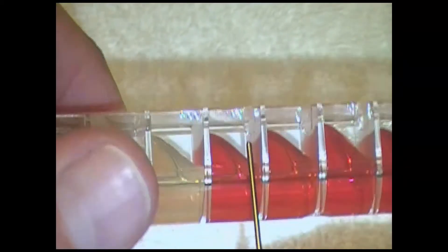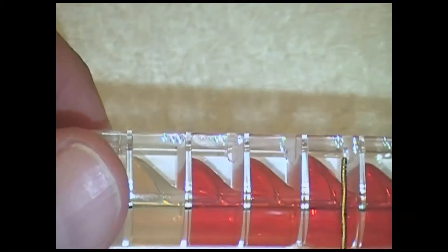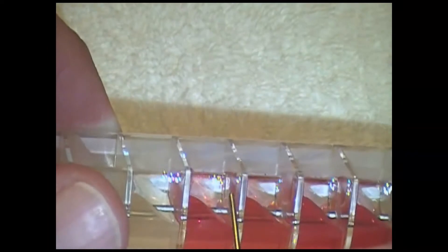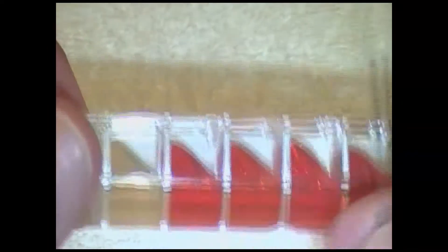You see these little openings in the plastic on the side here? We've got to perforate those. You don't want to take this and just try and push it through because that will cut the tape on the top, and if it cuts the tape on the top, it could allow for contamination.